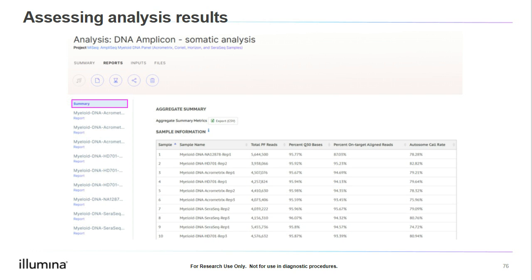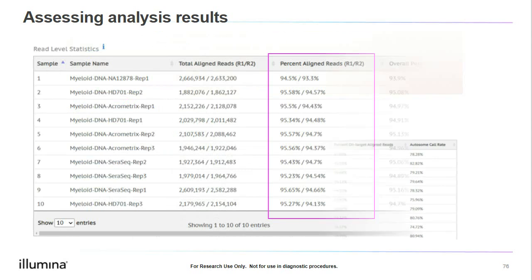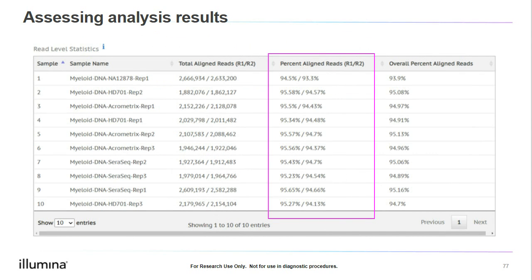Scrolling down this page, there are several tables, and I will review them in the coming slides. The first table I'd like to review is the read level statistics. To the right of the table title, there is a little eye icon. Whenever you see this icon, you can select it, and it will give you additional information about each of the metrics, what they mean, and how they are determined.